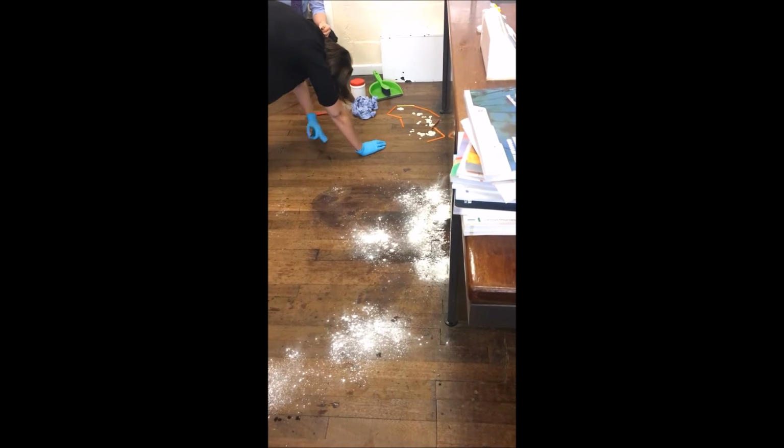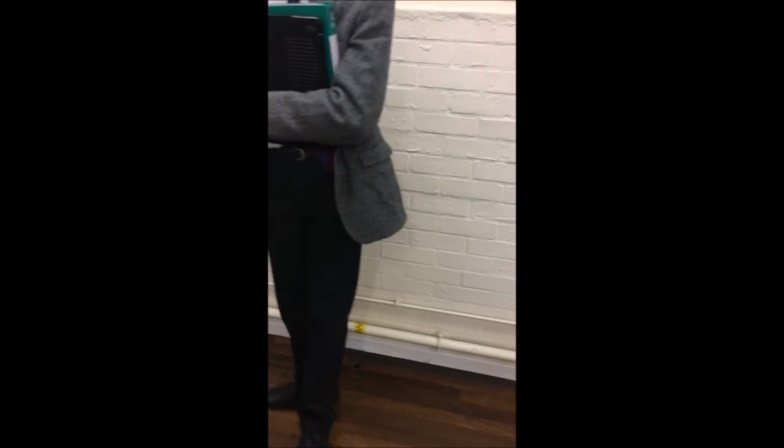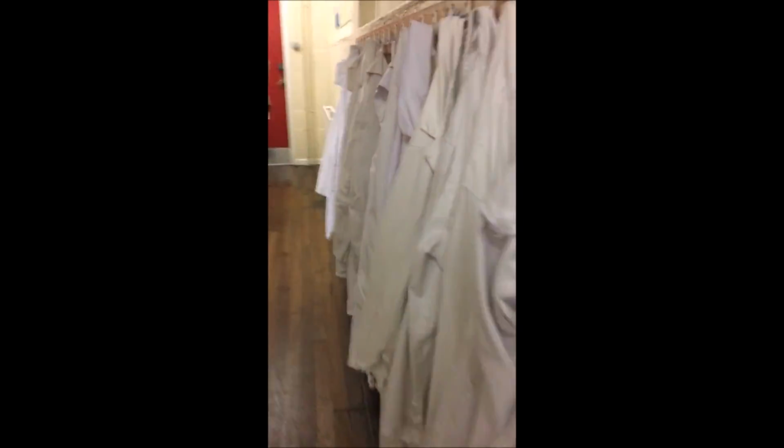Group of teacher trying to clean up the spilled oil. And because the mercury is toxic, we even have to go outside the classroom from another door, which is pretty serious. I just can't believe what just happened. It was terrible. That's what happened.